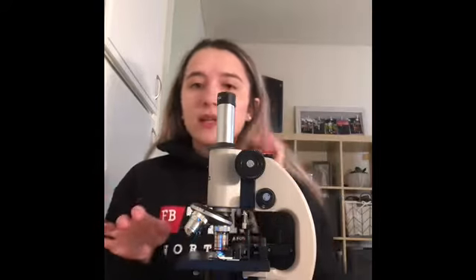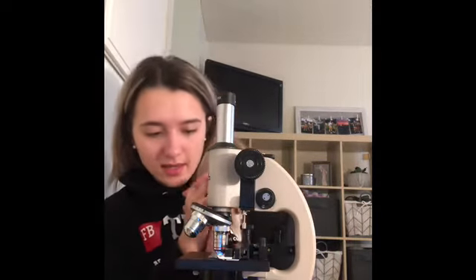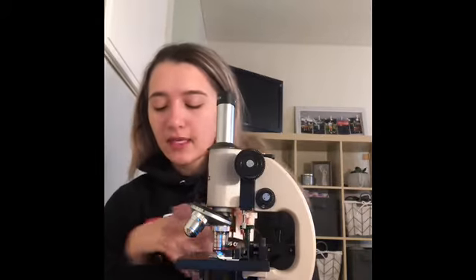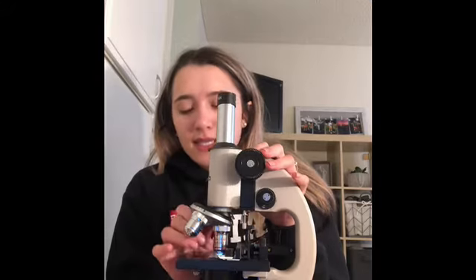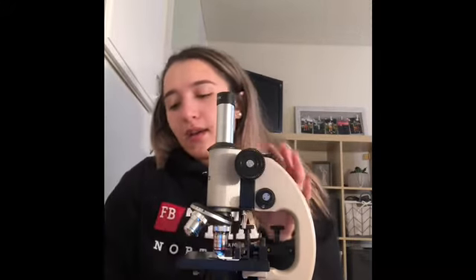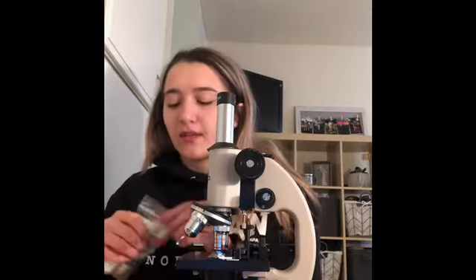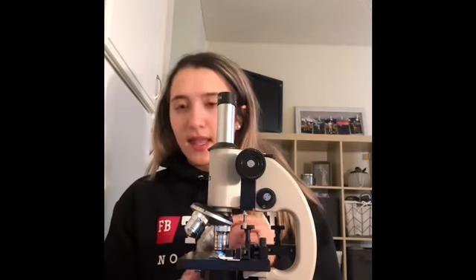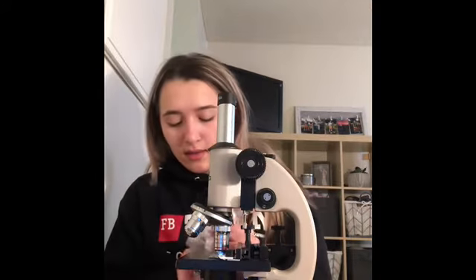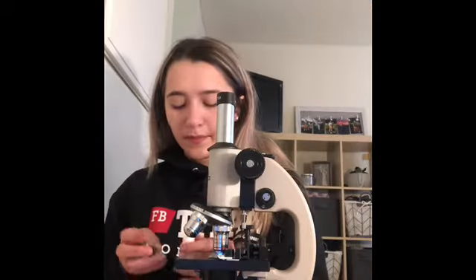Okay, so I have found the E. I found part of the E. I can't see the whole entire slide of the E, but I have taken a picture of what I do see. Now I'm going to replace the scanning lens with an 100 objective lens, and then I'm going to apply immersion oil on the slide and then turn the nose piece into position.